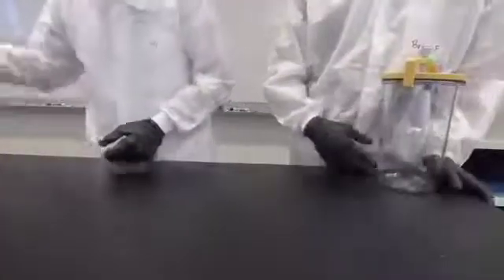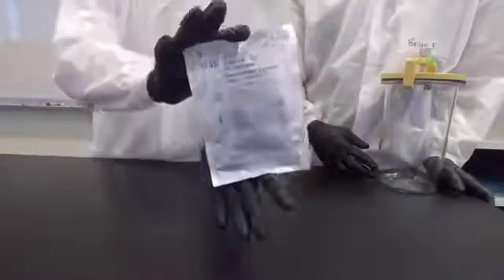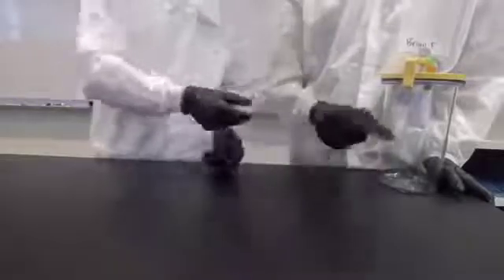You will first need a gas pack anaerobic jar and lid, and a chemical gas generator packet. This particular packet contains sodium borohydride and sodium bicarbonate.